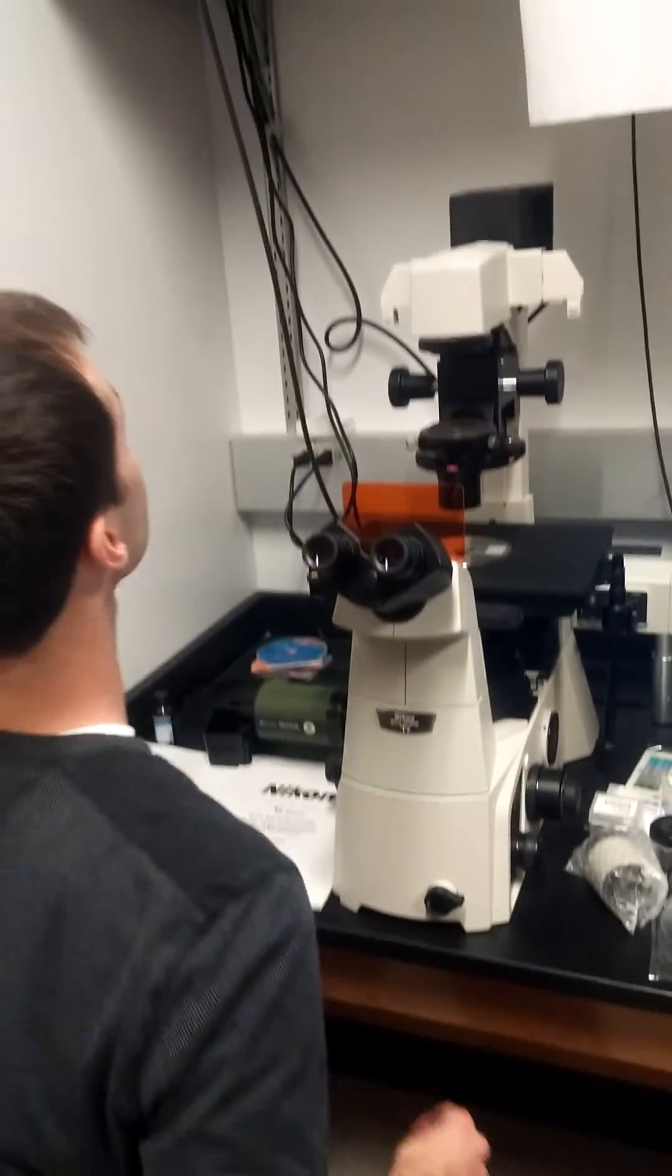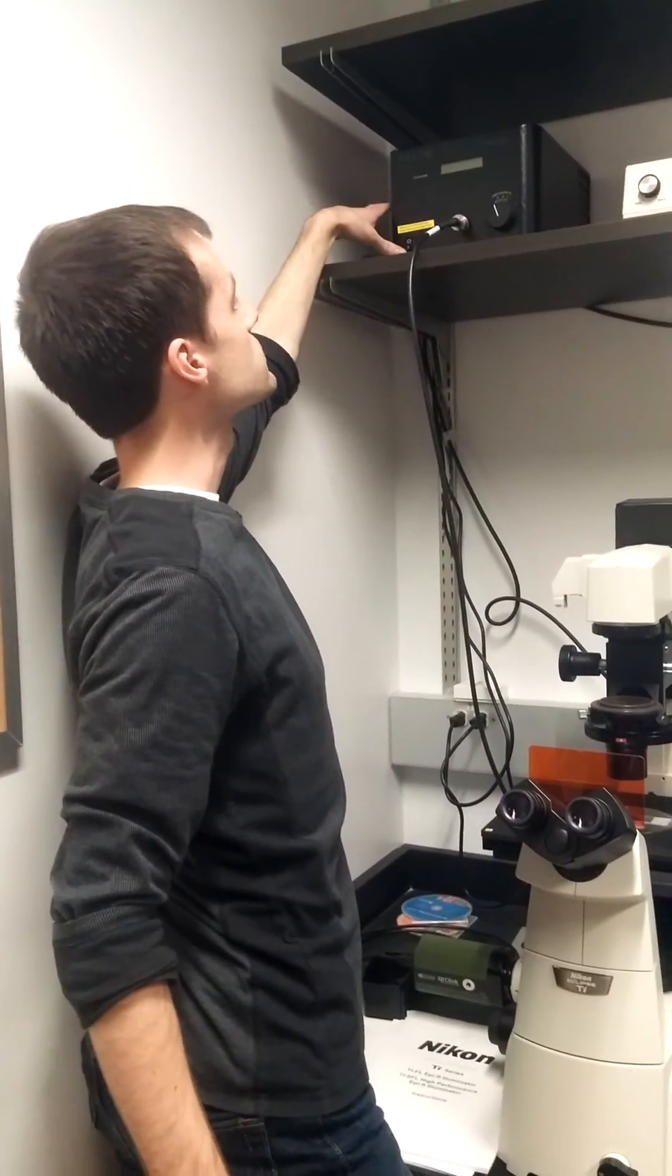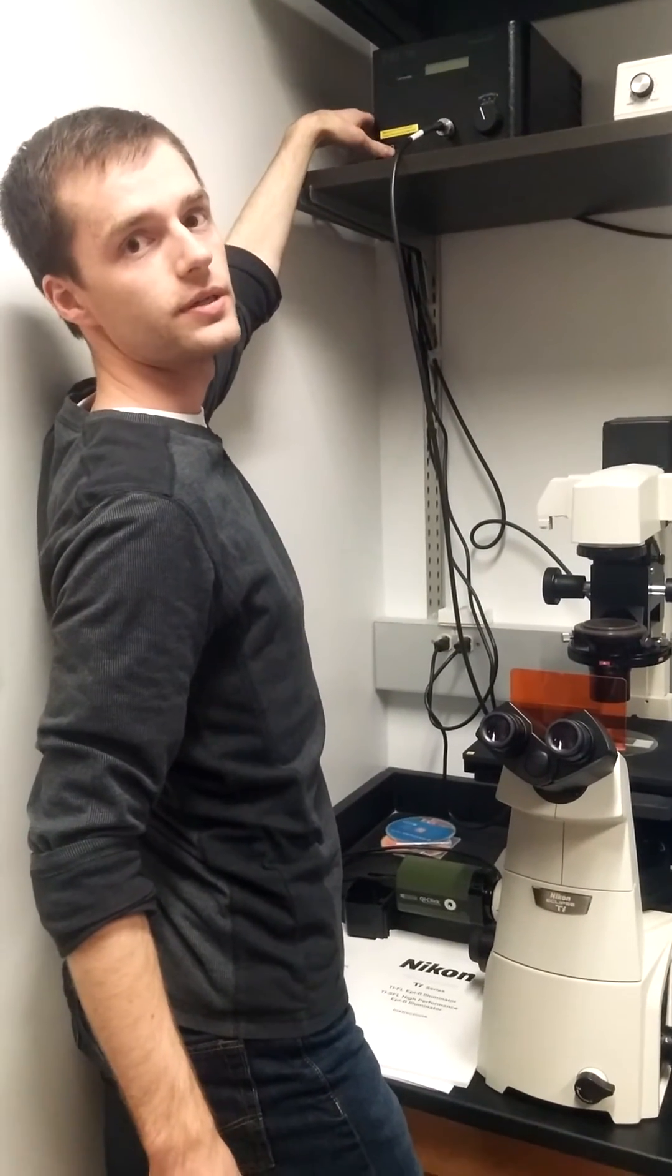And then go up to our fluorescence power supply and hit the switch here. I'm not going to do it right now, but that's where it is.